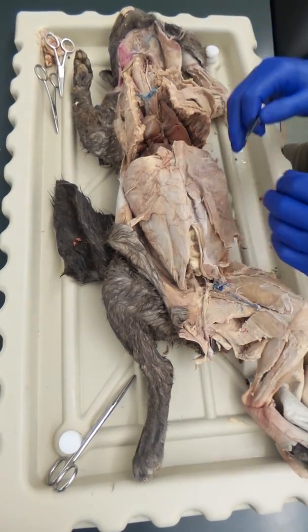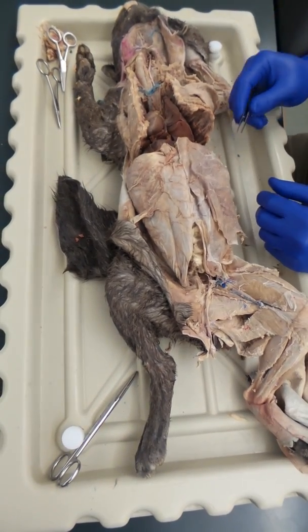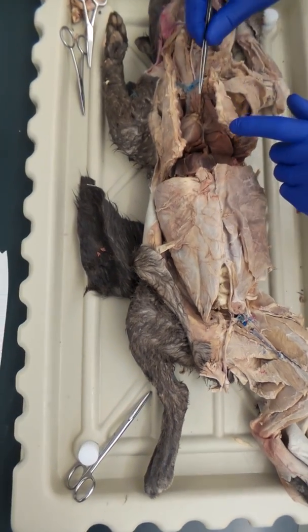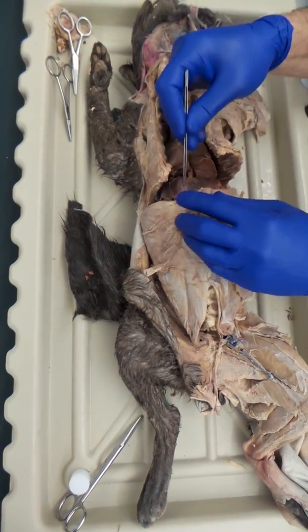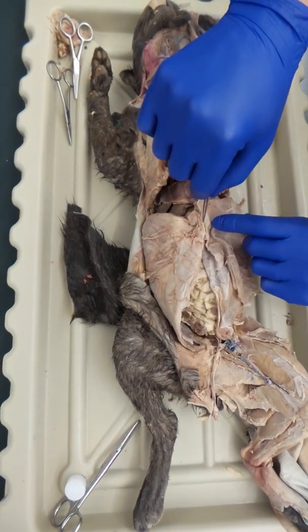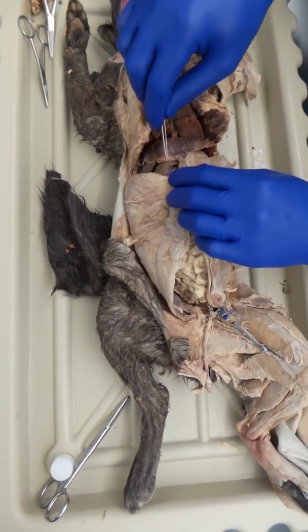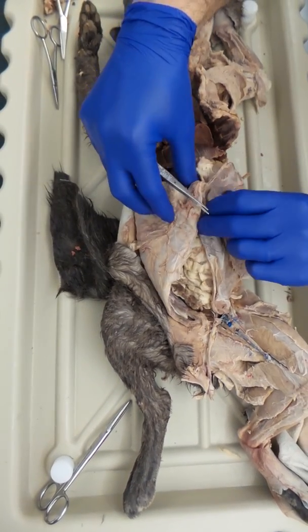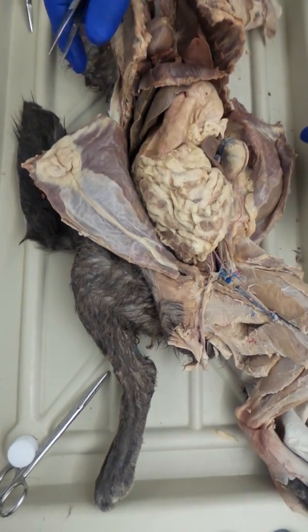We're going to look at the vessels and organs of the abdomen and leg. Last week we went ahead and cut through the thoracic cavity and became familiar with all those structures. This week you want to start off right about here at the diaphragm, make a cut straight down to the legs. You can see I also cut down along the diaphragm so you can open things up similar to this.